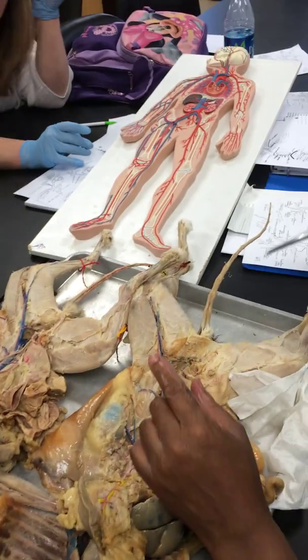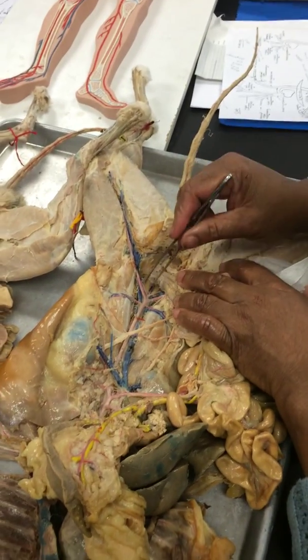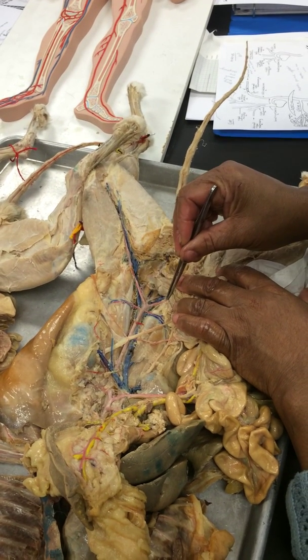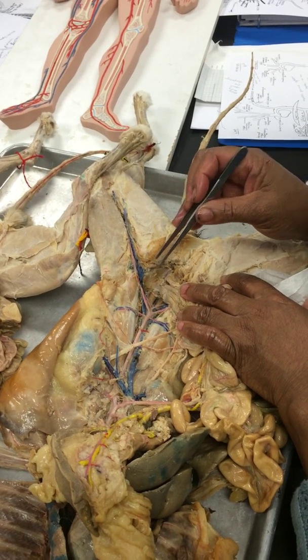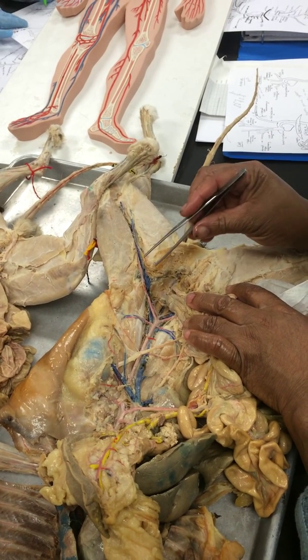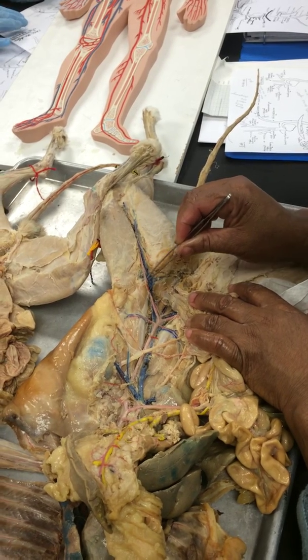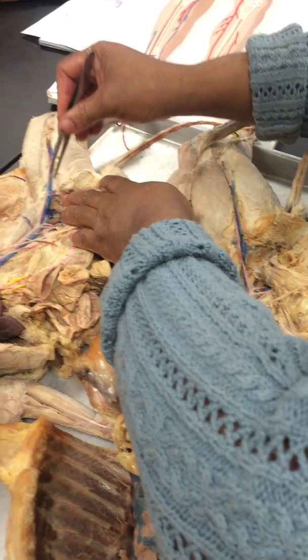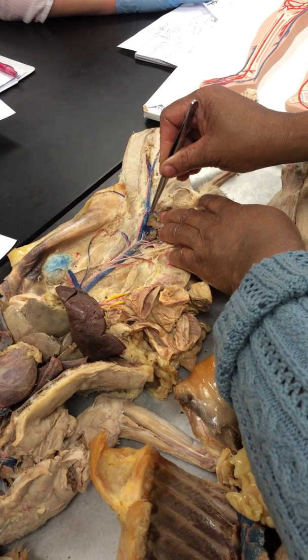Okay. Alright, so let's do the cat and then we'll compare it to the human. So here's a cat. When it branches, we're doing the red ones. The first time it branched, that's the external iliac artery. And it's external iliac until it branches right here, and this branch is broken. Let's see if it's in here. Okay, you can see it. It's external iliac until it goes into the groin.